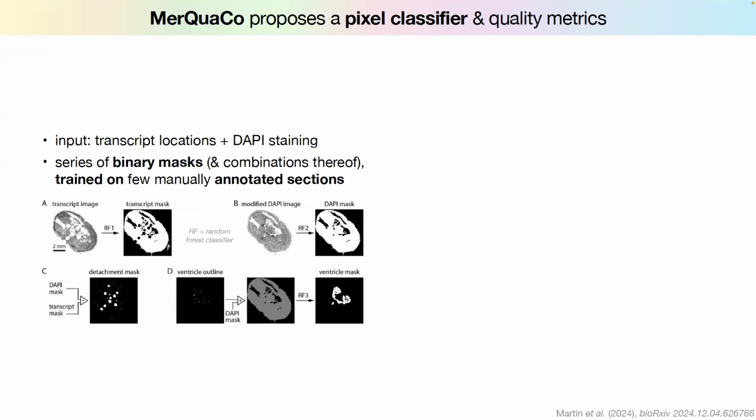So one is a transcript mask that tells us which pixels here have transcripts. One is a DAPI mask. We can subtract the DAPI from the transcript to get a detachment mask. And I'm cutting off some more complicated combinations of these where they create binary masks on the tissue. By combining these, they can classify the pixels in the image.